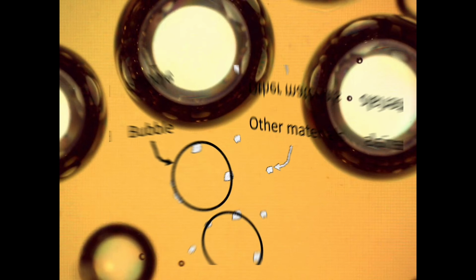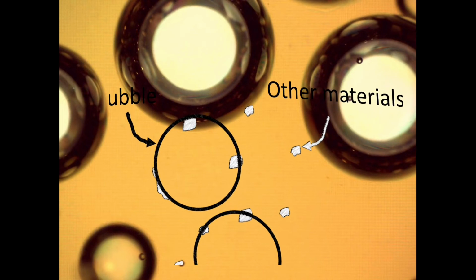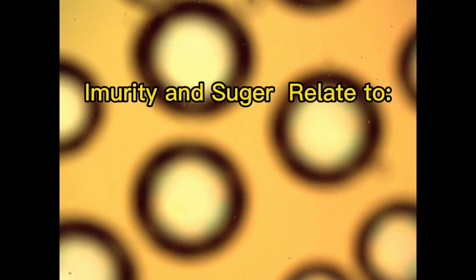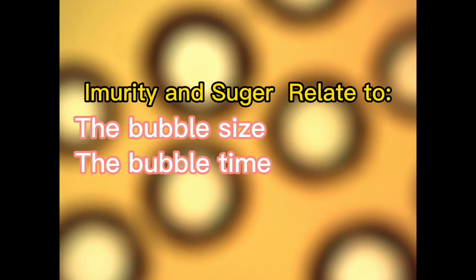And if the impurities in the cola can fix the bubble, it can get bigger. Therefore, according to our result, it can be explained that the Coke of brand A should still have enough impurities to bind many bubbles, but the bubbles may not be able to remain large because of less sugar.